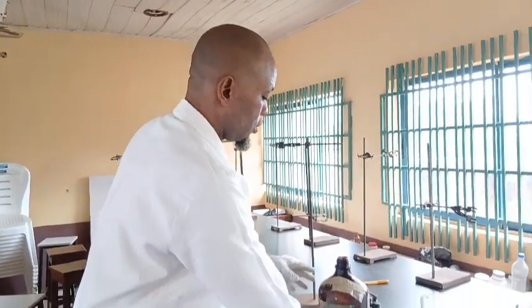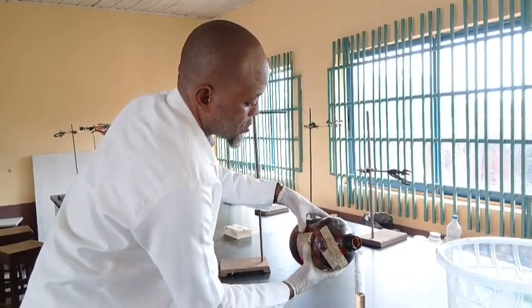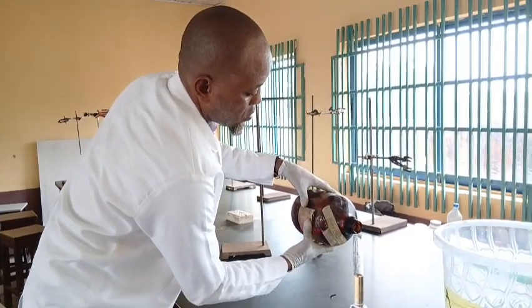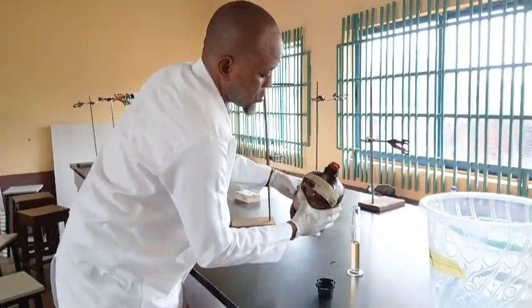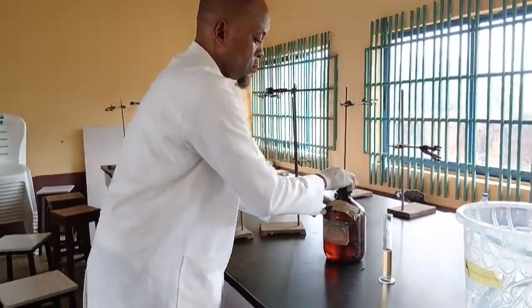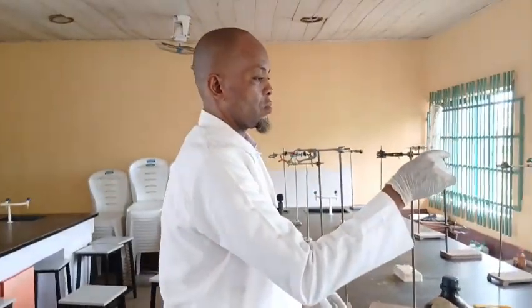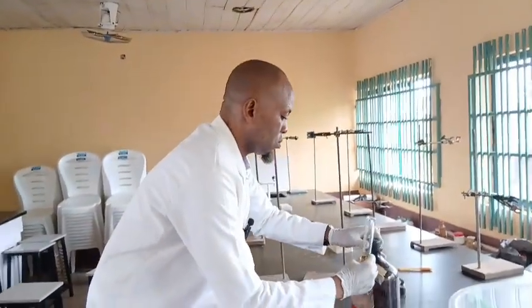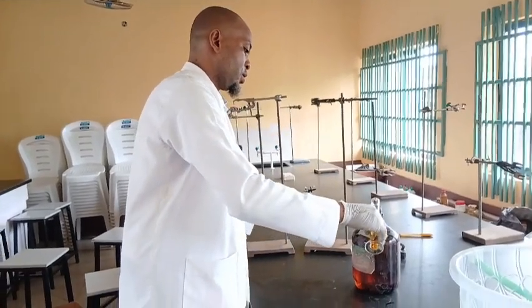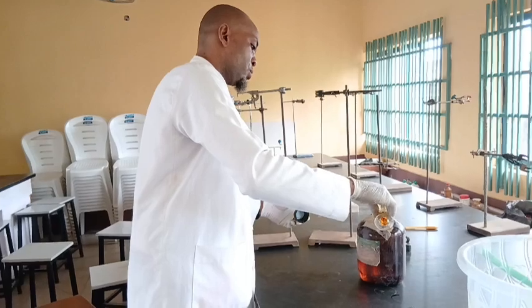Because it's a little bit more, I'm going to return just a drop or two.